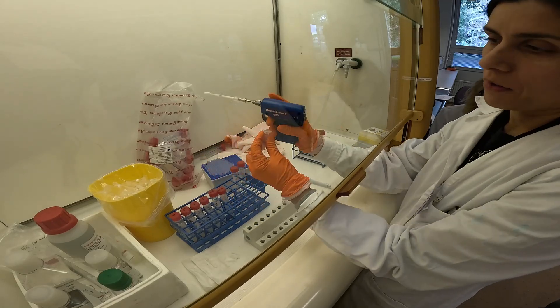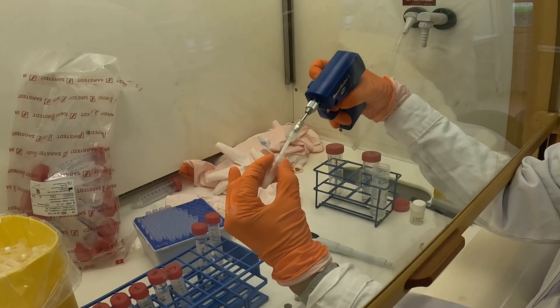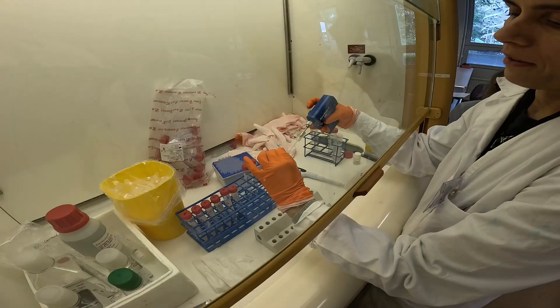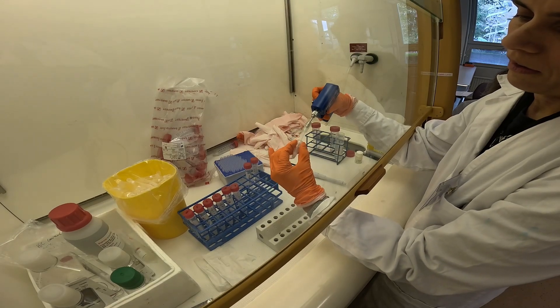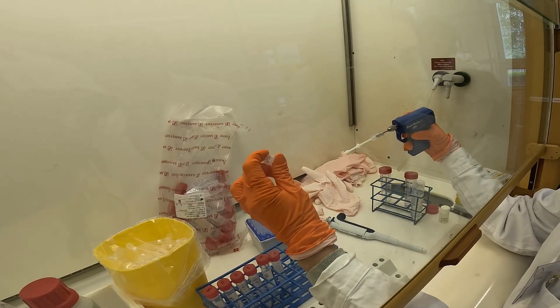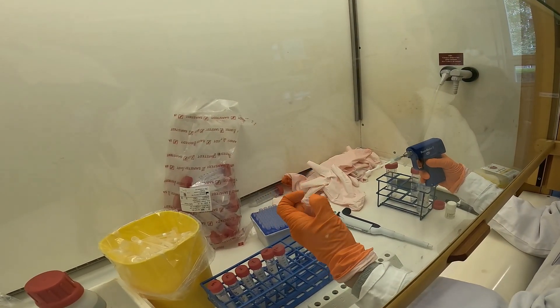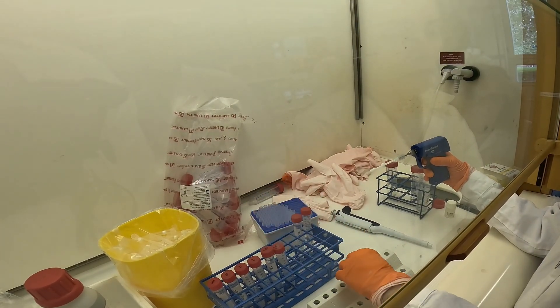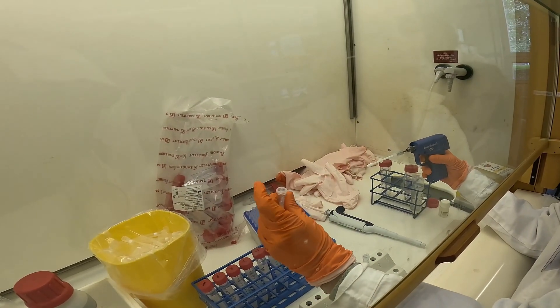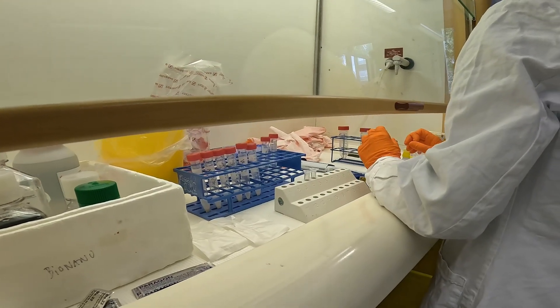Now these samples — it's cloudy, but with some remaining material, I think it's fine. We normally have this kind of material. So tube nine is better than tube two, but I don't want to over-crush. They are the same samples — well, same species, but different groups of samples.